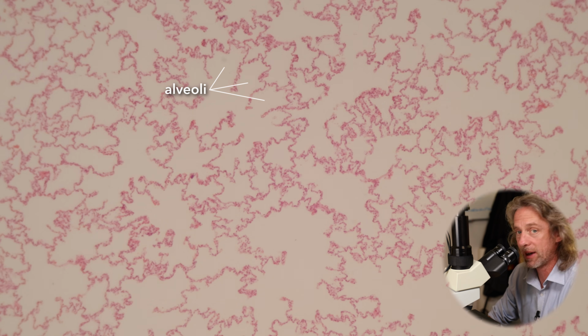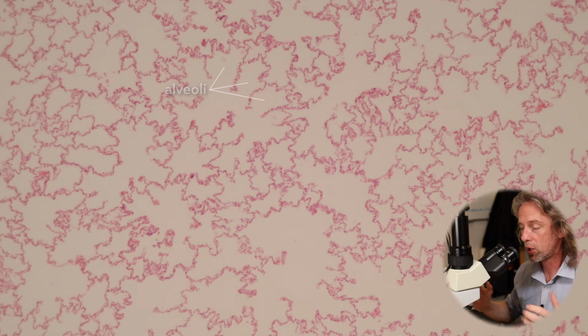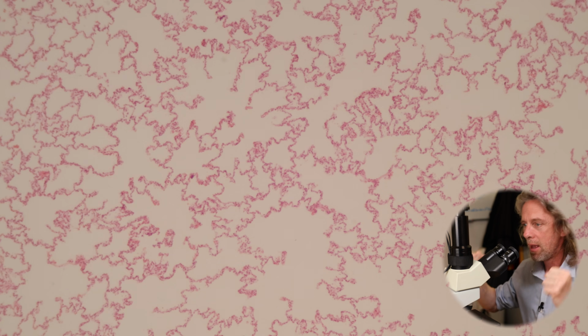We've got big blood vessels because what's going on inside the lung is gaseous exchange, so we need huge vascularity, a huge amount of blood, huge surface area of blood, huge capillarization. We need a huge interface, a huge surface area between the air, the gas, and the blood, and that's what we're seeing at the alveoli. They are filled with capillaries, they're super thin walled. We're looking at lots and lots of surface area.